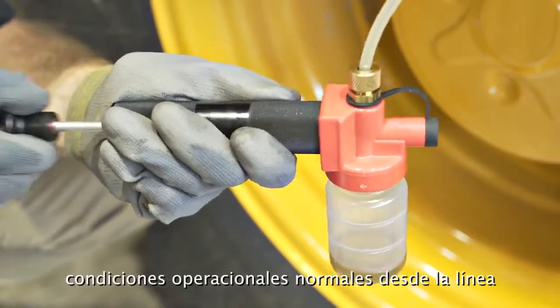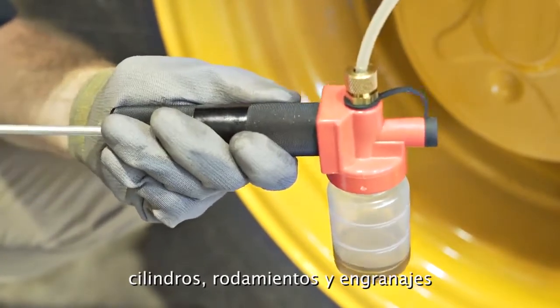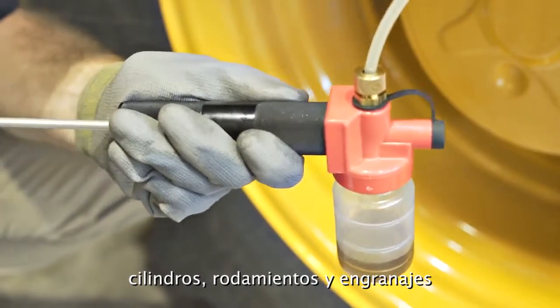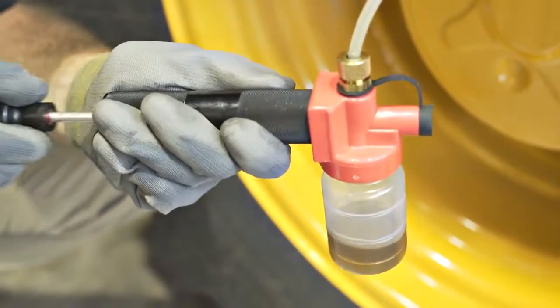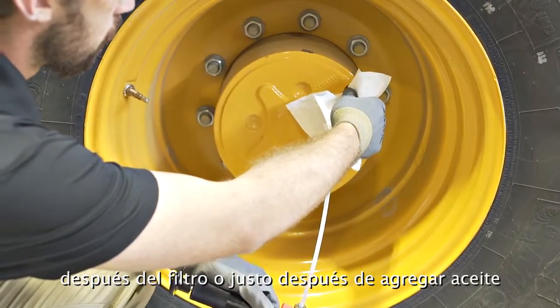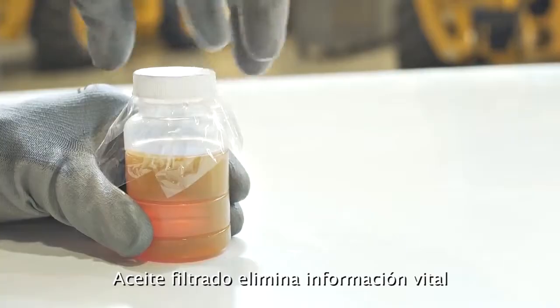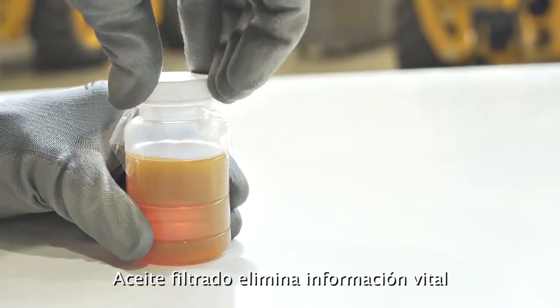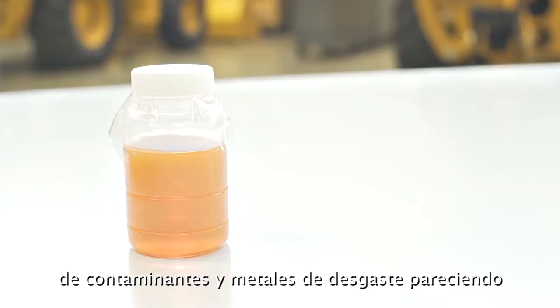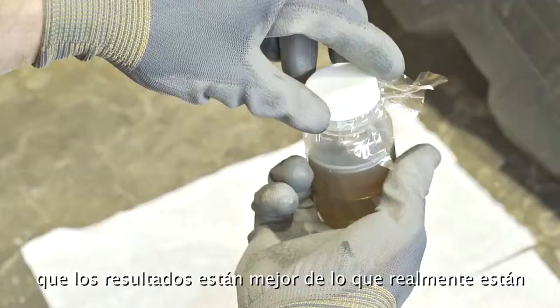Sample stationary equipment during normal operating conditions in return lines or downstream of pumps, cylinders, bearings, and gearboxes, and upstream from the filter. Do not take samples right after a filter change, on the outlet side of a filter, or after makeup oil has been added. Freshly filtered oil removes valuable information. Adding new oil dilutes the levels of contaminants and wear metals found, which may result in conditions appearing better than they actually are.